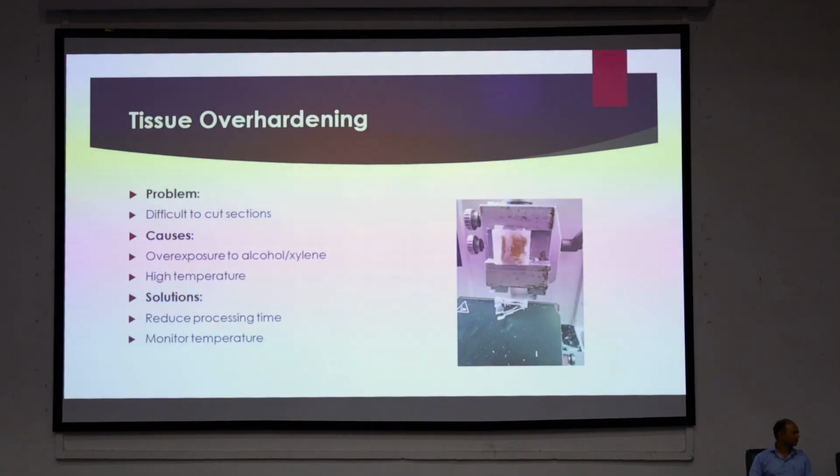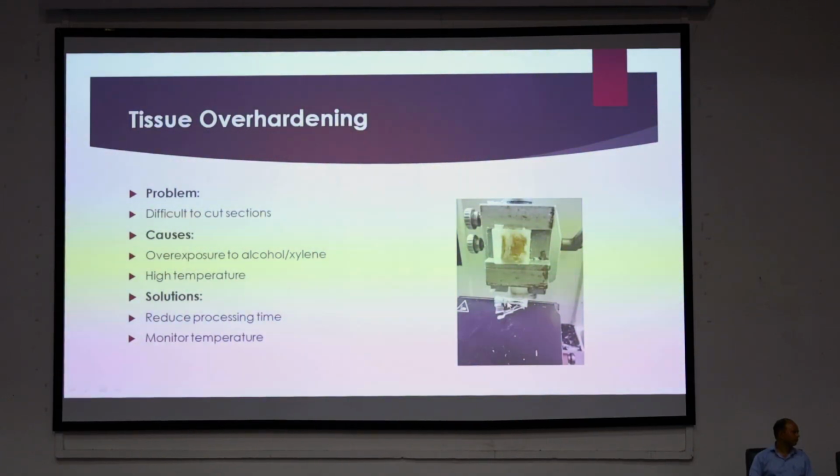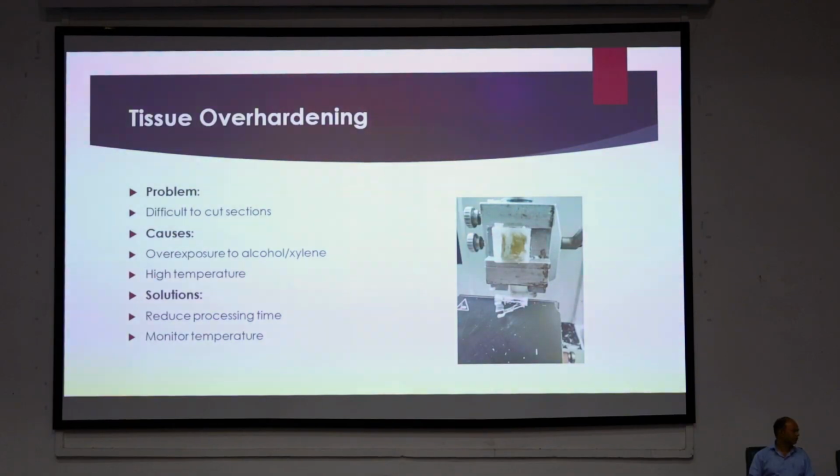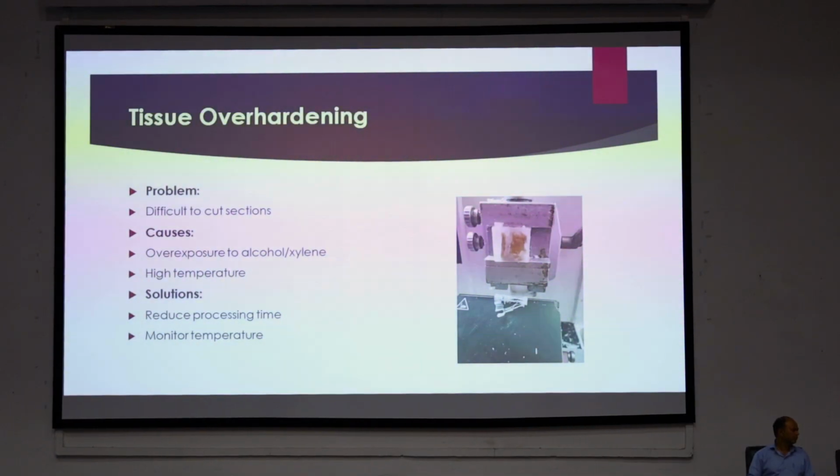Tissue overhardening. In tissue overhardening, the tissues become difficult to cut. As you can see, it was not possible for me to cut this section, so I have taken a picture of it. The cause of this is overexposure to xylene or alcohol. Both xylene and alcohol make tissues overly hardened, as does high temperature. High temperatures increase the penetration and decrease the penetration time. So if the reagents have penetrated well enough in less time, then normal time may be excessive for the tissue. As both alcohol and xylene are involved, you need to reduce overall processing time and monitor temperature regularly.